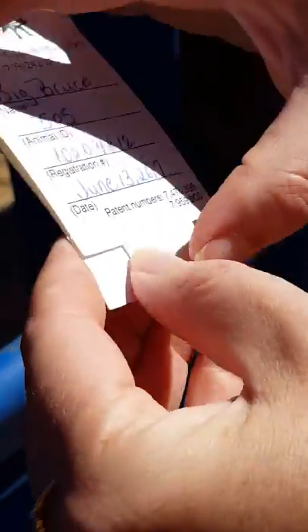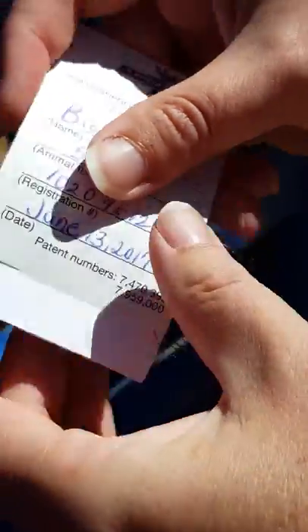You'll put this part down, and this part we don't need, so you can cut that off.